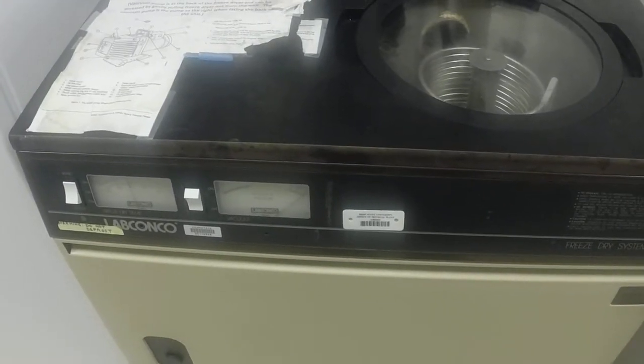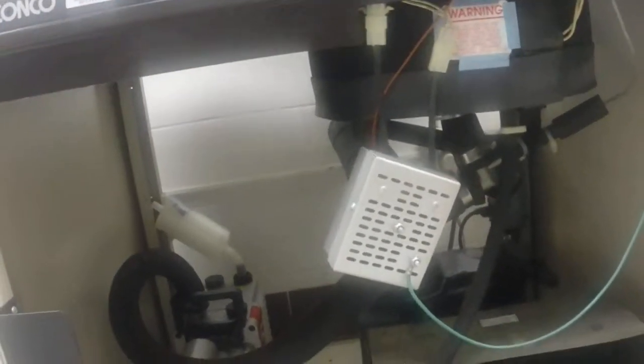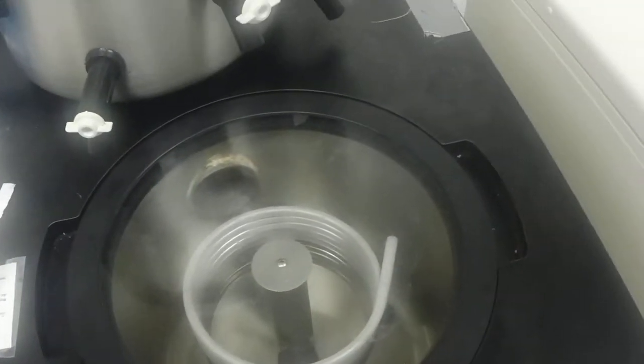While it's cooling down, I'm going to explain how it actually operates. Inside there's an Edwards pump and that pump is responsible for pulling the vacuum in the back, pulling a vacuum into this chamber where the freezing coil is. Samples are placed either inside the top chamber or they can hang as bottles from the side. You can see the ice now forming on the coils behind here.